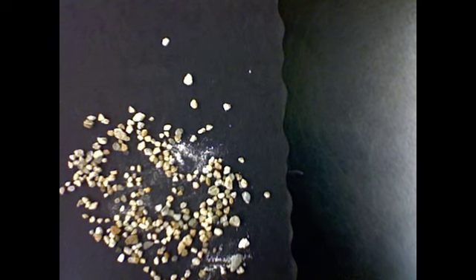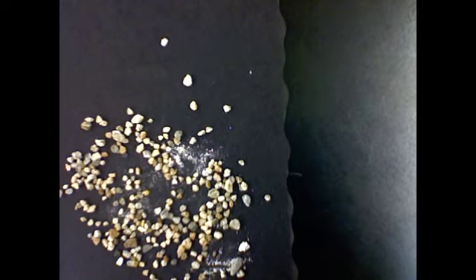All right, let's move on to the next one. Powder. Now I'm going to give that powder a little shake before I put it down so we can watch it spread out. Color. Wow. It's pretty obvious. Yes, I would say white. White, white, and white. Texture.